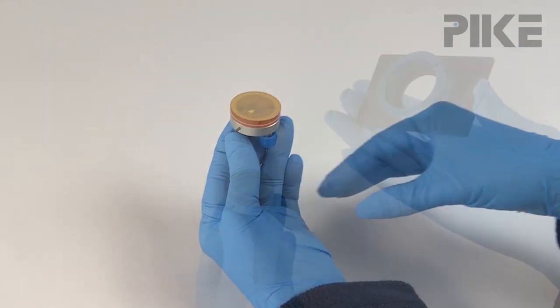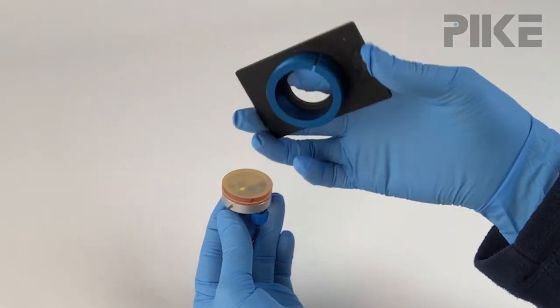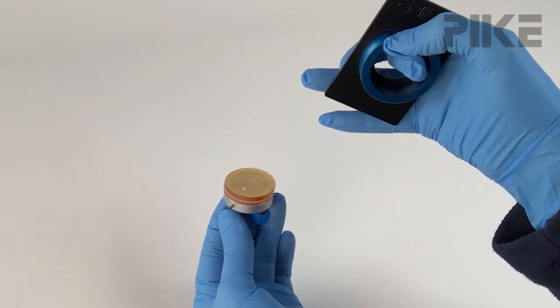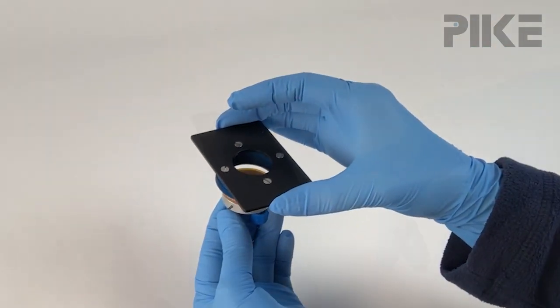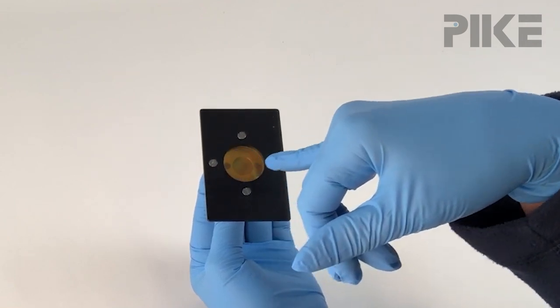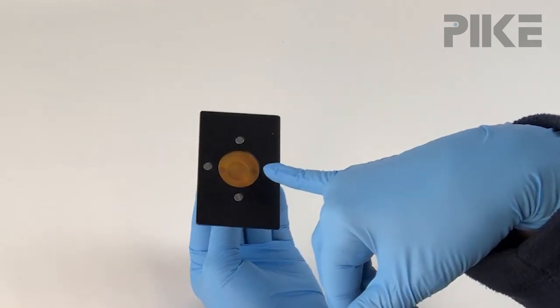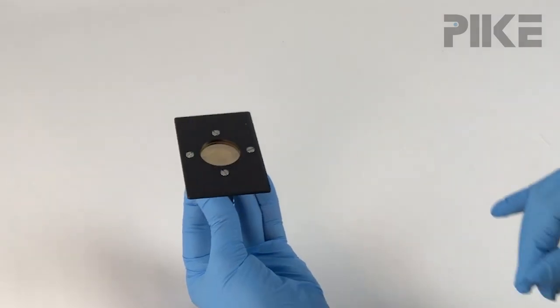To complete the cell, we're going to take the back plate and drop it over the cell. We're going to make sure this slot is aligned with that pin. It's a little tricky and takes a little patience. Now once your cell is aligned, you can still see the O-rings on the back side, and be sure that your drilled holes are still over the O-rings.